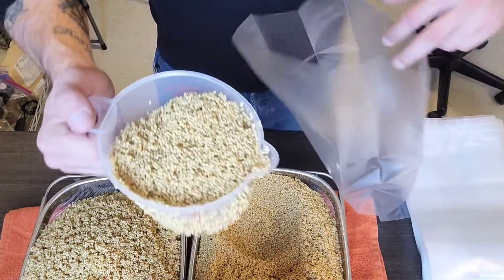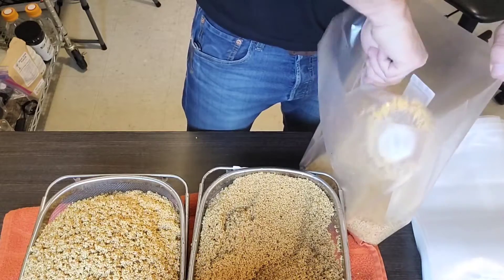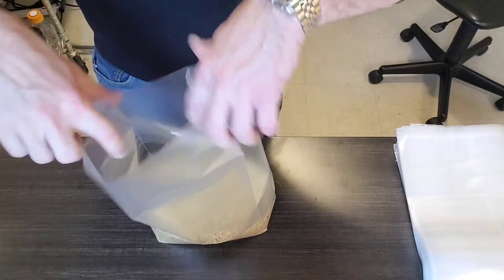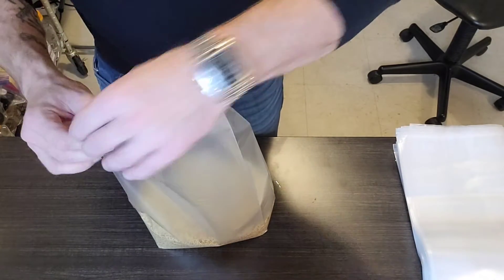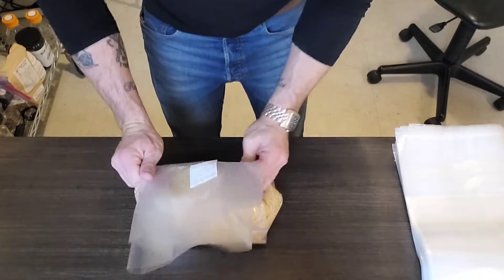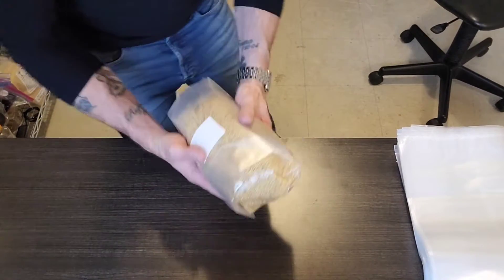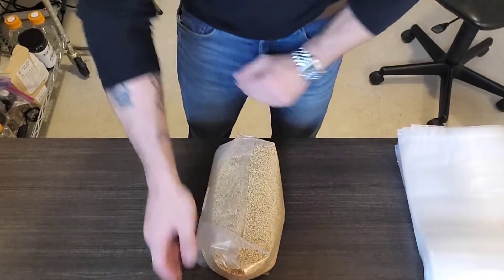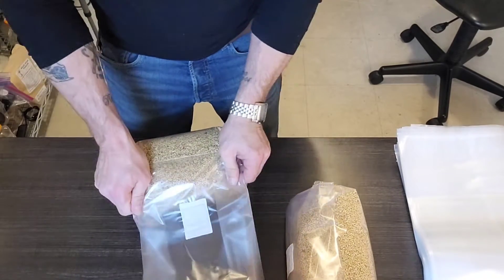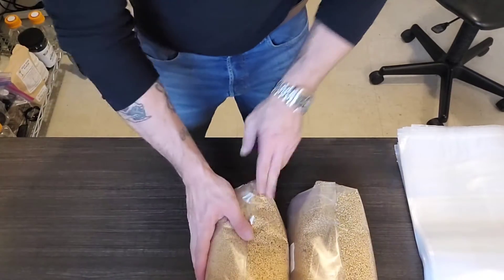Each bag is going to get three quarts. After they're filled, match the gussets - doesn't have to be perfect. Squish the air out, wrap around, there you go. You need enough for four bags. Filter facing outwards.